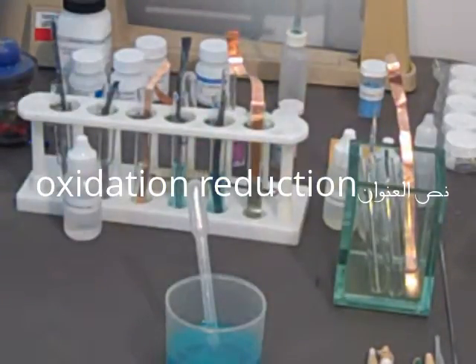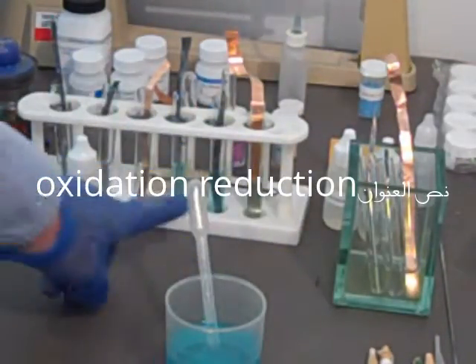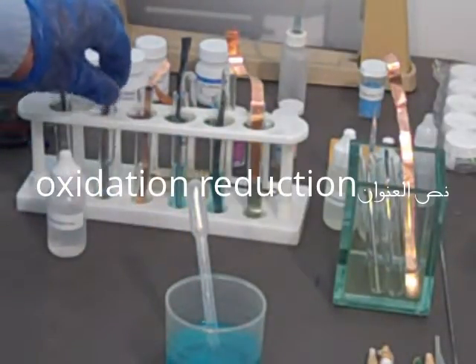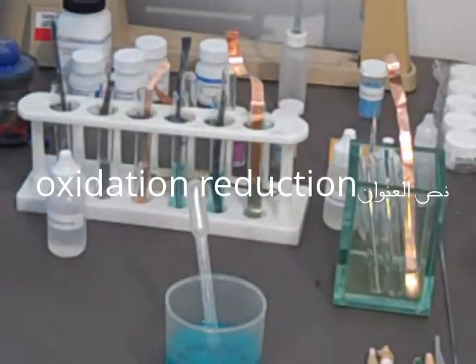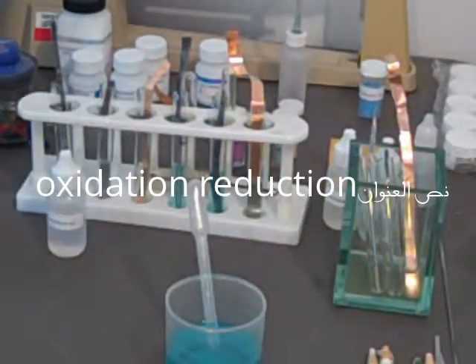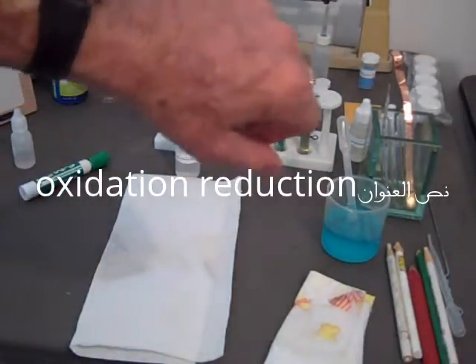And we're going to put lead and copper strips into the other test tubes. I don't have any more test tube rack, and we're going to try the zinc chloride solution in those three. Not so easy squeezing from these little bottles. We're only getting about one and a half milliliters for this round. We're going to look at it initially and see if there's been any change right away. I don't see any in the zinc chloride—there's not supposed to be any in there. But I see something on the lead over here. It looks like it's blackened. And the lead here doesn't seem to have reacted. I don't see anything happening with the copper. We're supposed to wait now for 5 to 10 minutes.